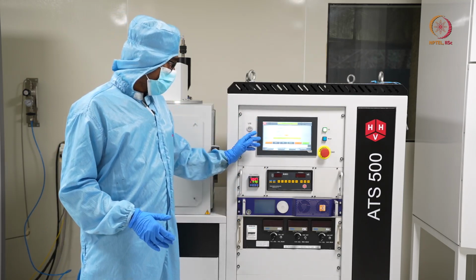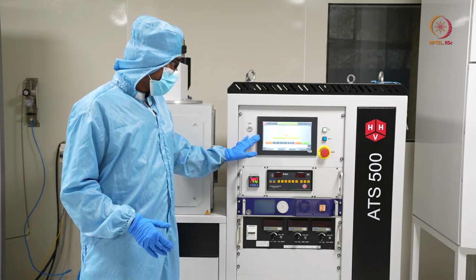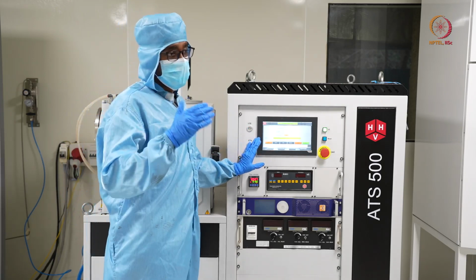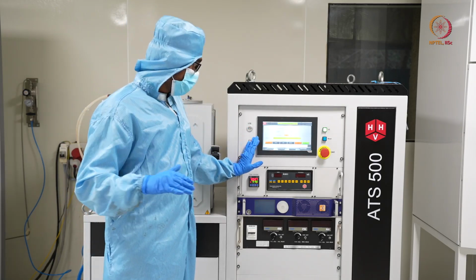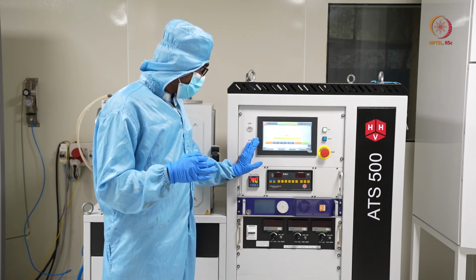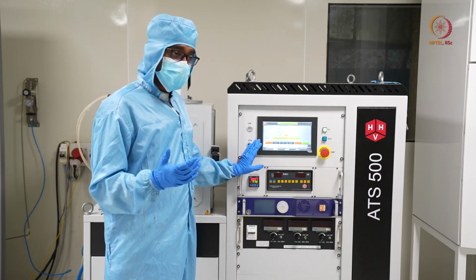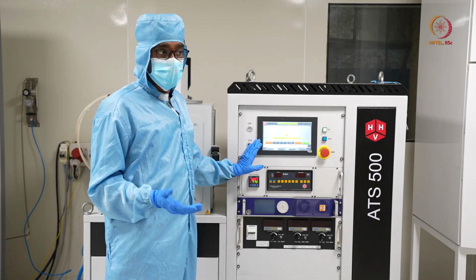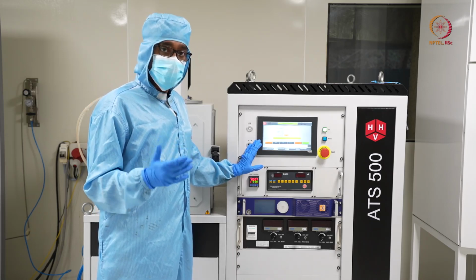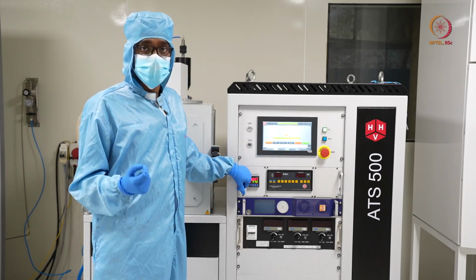But for the rotary pump to be stopped, it requires that the turbo pump speed or its RPM be below a certain level; till then the rotary will be on as a backup. Actually, it will show standby, but for better health and longevity of your tool, after pressing stop you can wait for 15 to 20 minutes.